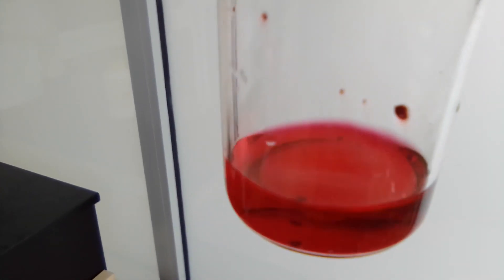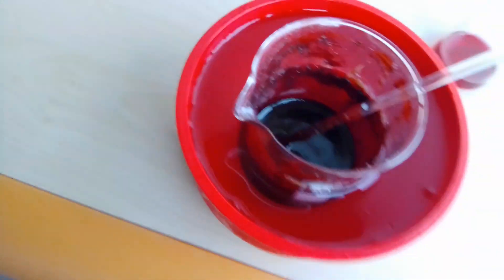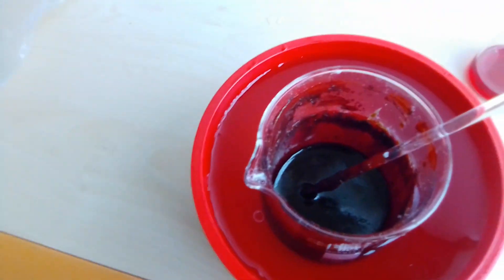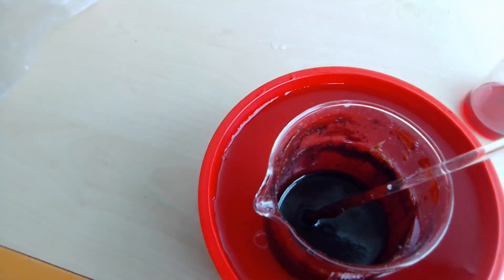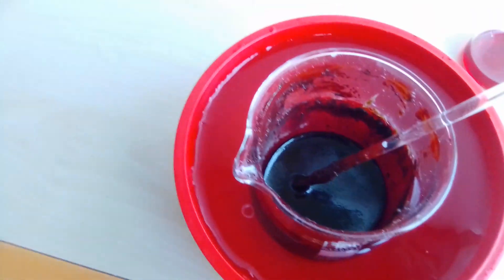As you can clearly see there is some dye. I have put it into a basic solution of sodium hydroxide and it dissolved — it kind of looks like phenolphthalein actually. I'll call it a success. The problem is I have to cool this mixture for 20 hours to decrease the temperature slowly — well, at least that's what the paper says. The paper is from 1938.